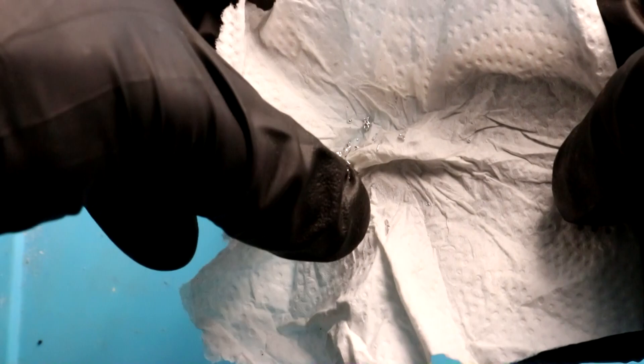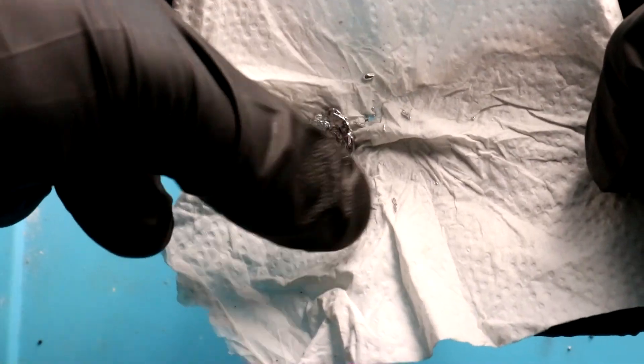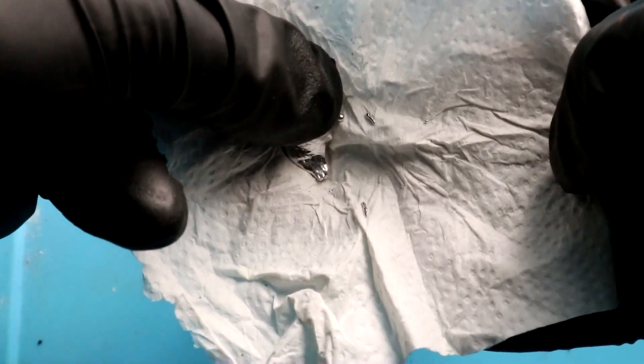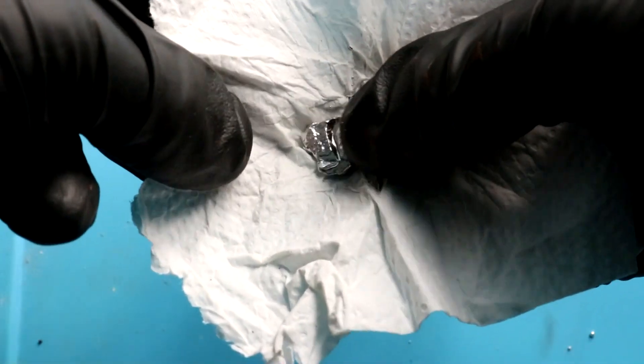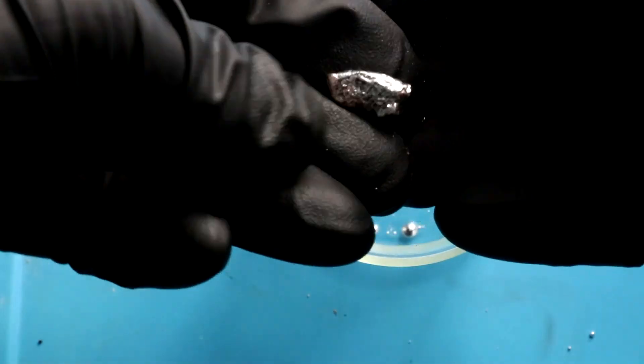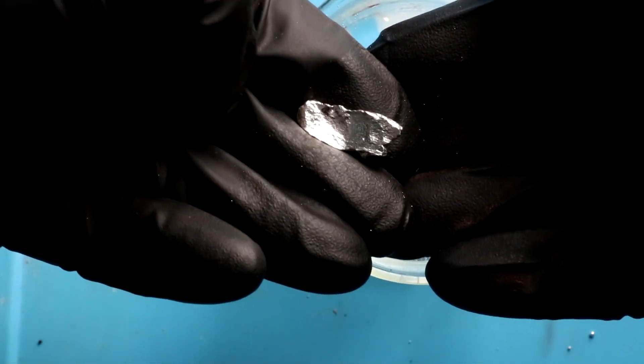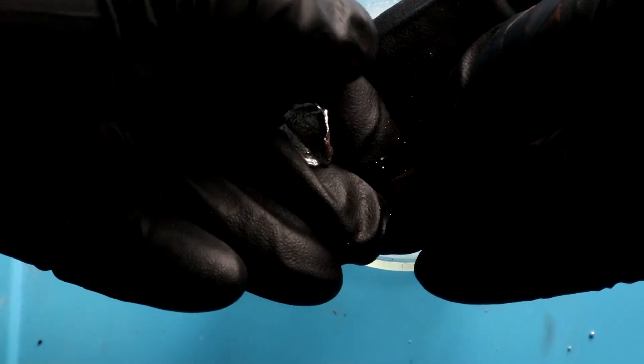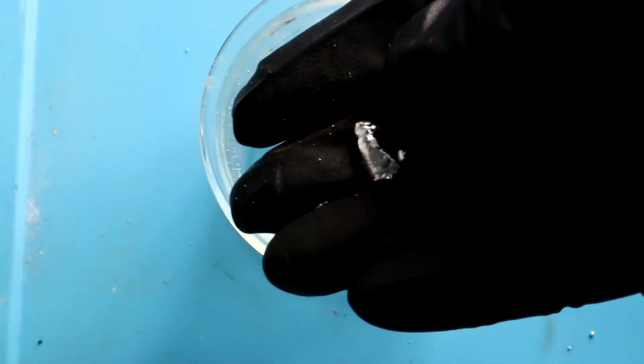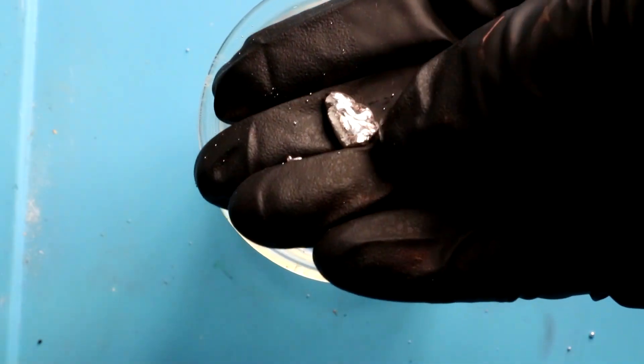Looks like some mercury in a semi-solid state to me. Kind of a consistency of dough. I can see why people would think that this has mystical properties. This stuff looks so weird. Look at this. It's rather pretty.